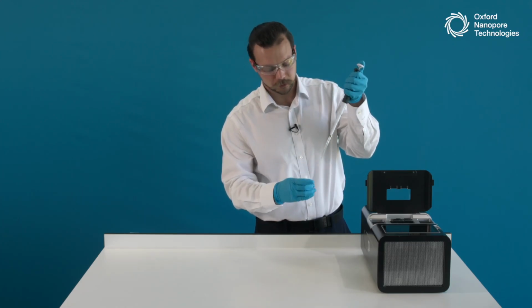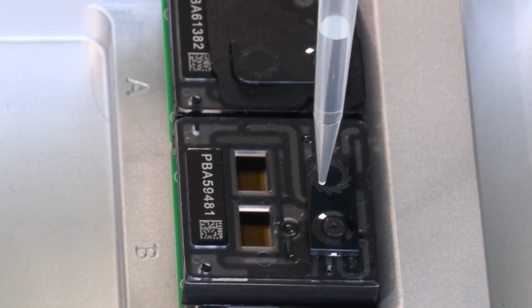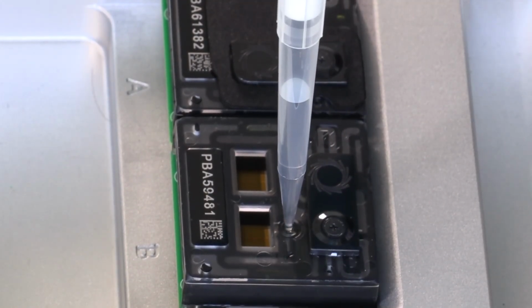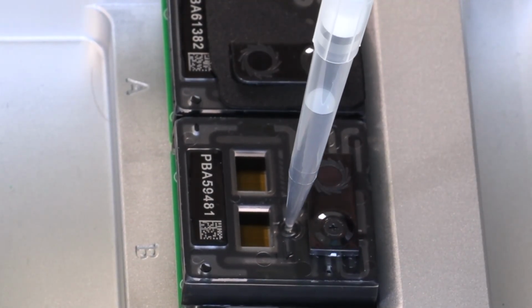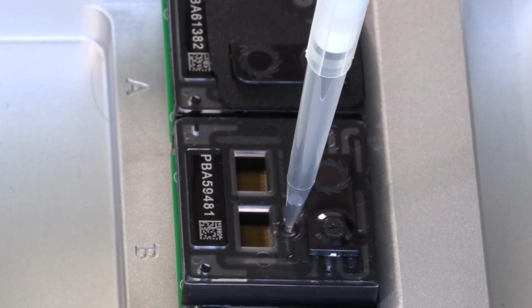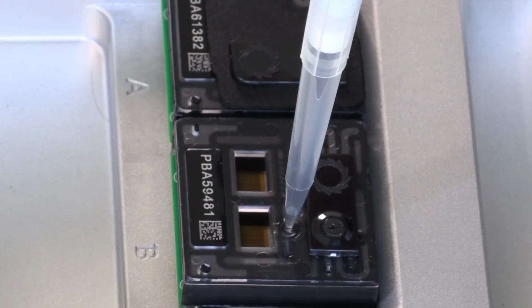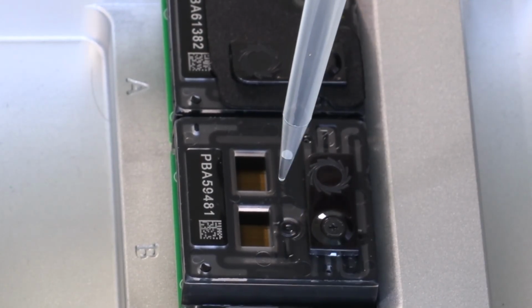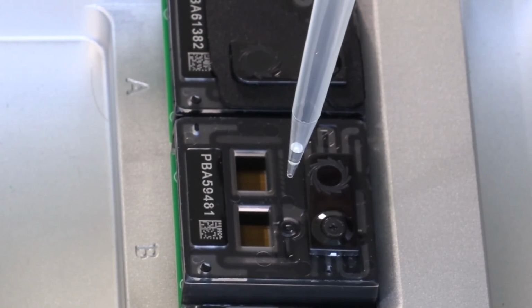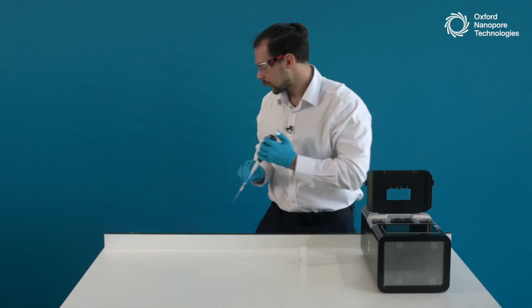I take the first 500 microliters, make sure there is no air in the pipette tip, insert it into the priming port, and carefully and gradually expel the liquid into the flow cell. This liquid right now, this priming buffer, is going directly onto the array. I will leave a little bit of liquid inside to make sure I'm not introducing any air into the flow cell, disconnect the flow cell, and this way I know that there was no air that went onto the array, so my nanopores will not get damaged.